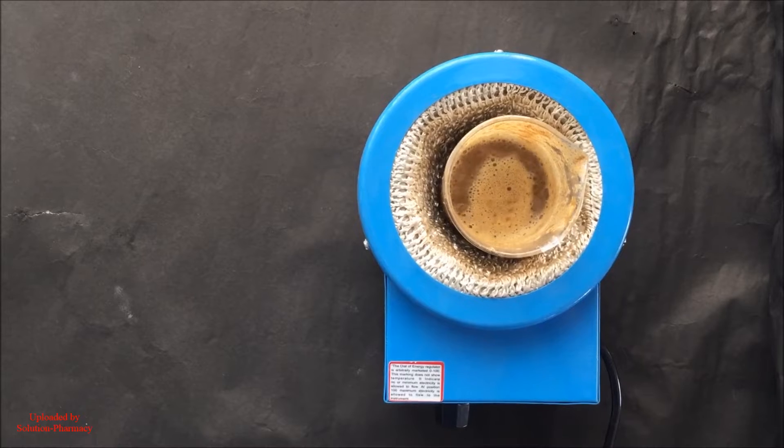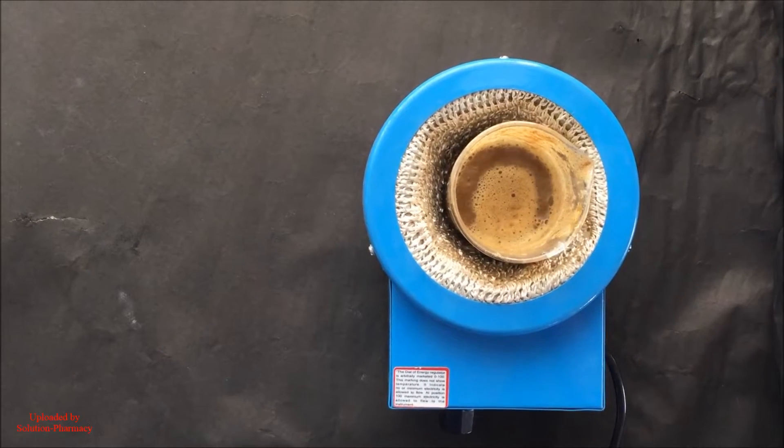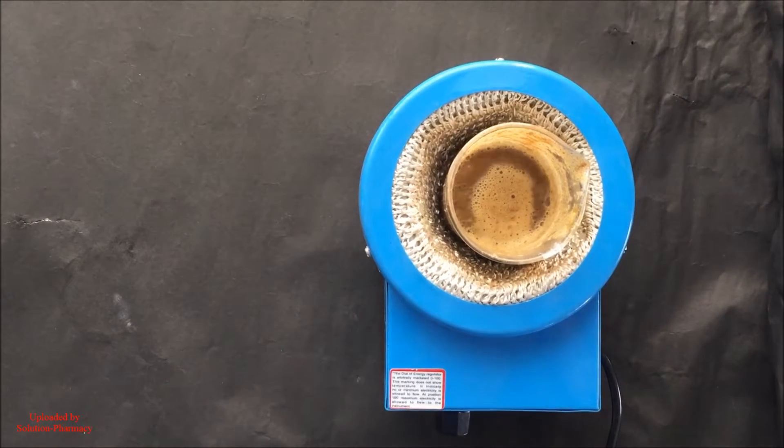Boil the content of the beaker over the heating mantle for about 15 minutes to prepare the aqueous extract of our sample, crude drug powder.